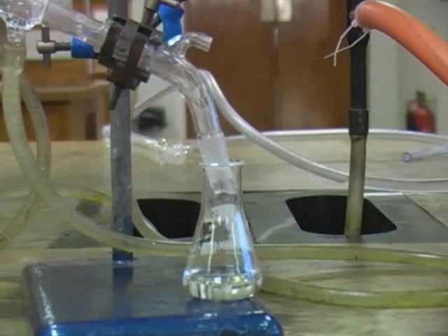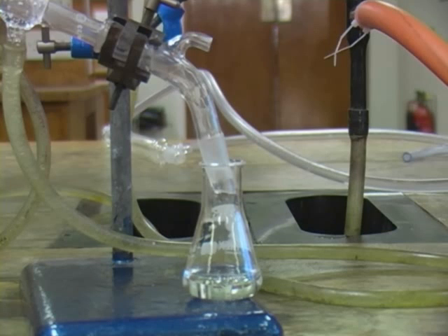Here you can see the distillate which is a mixture of water and oil as it runs from the condenser to the conical flask via the receiver.